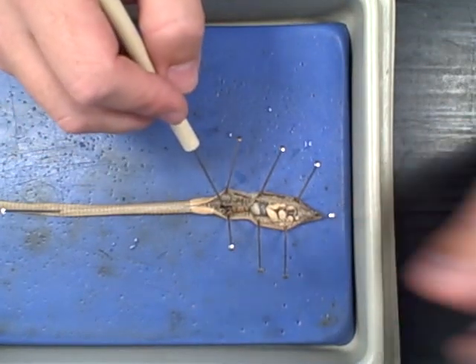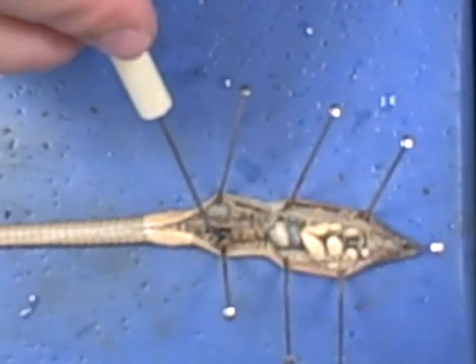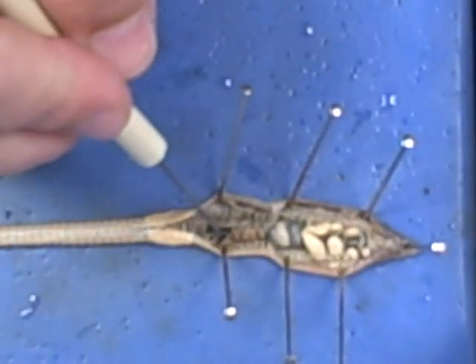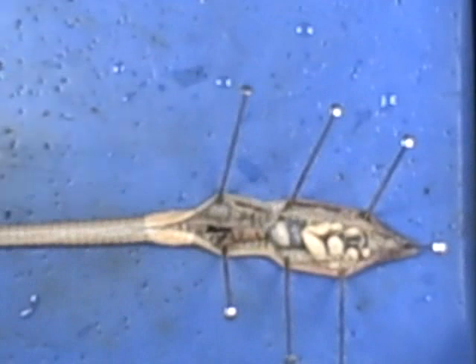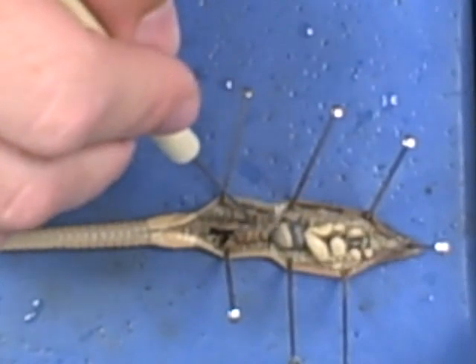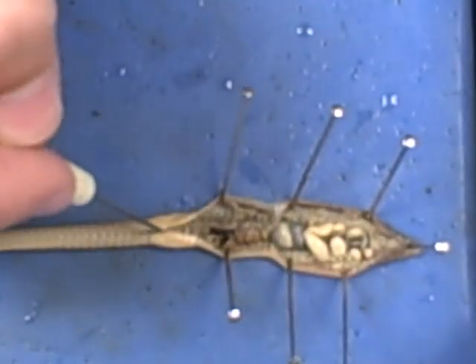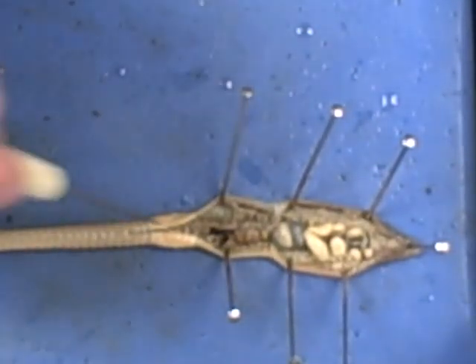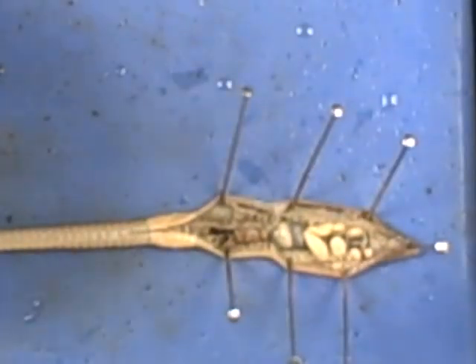You can see here where I had cut my worm. That is just topsoil — that's the intestines. You should be able to identify most, if not all, of these organs. Be sure to touch the organs with the dissecting probe or your own fingers to see what they feel like. It is not necessary to cut all the way down because it's just the digestive tract from there on down. Any other external pores should have been looked at before the dissection. Remember: external first, internal last.